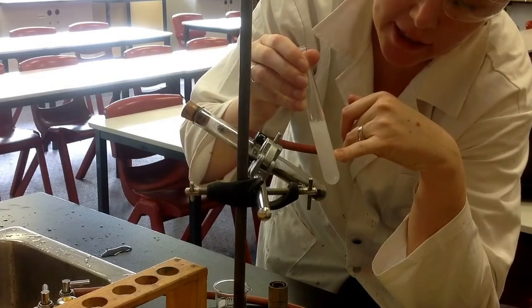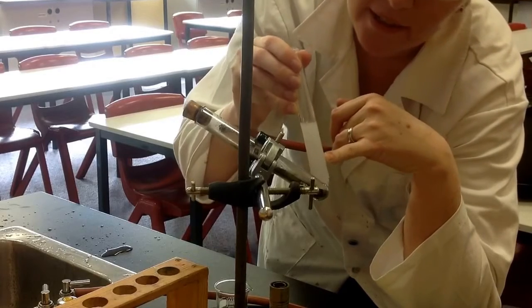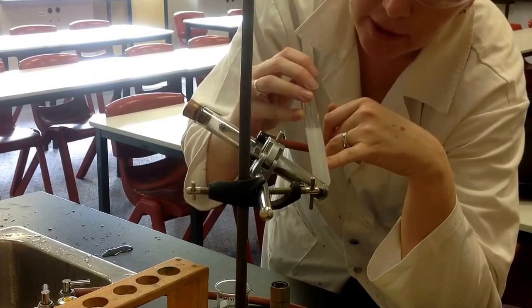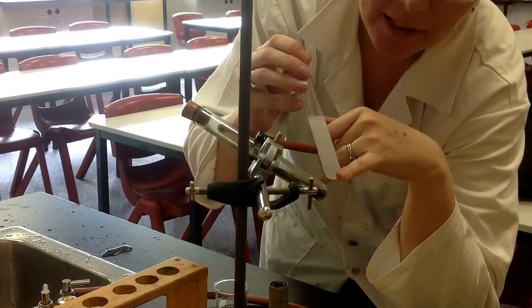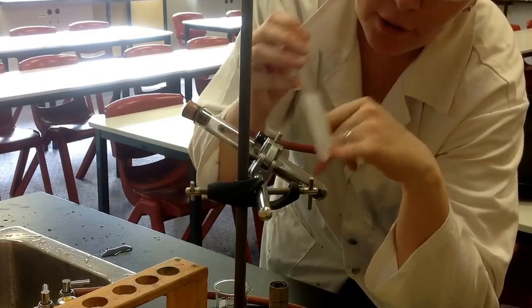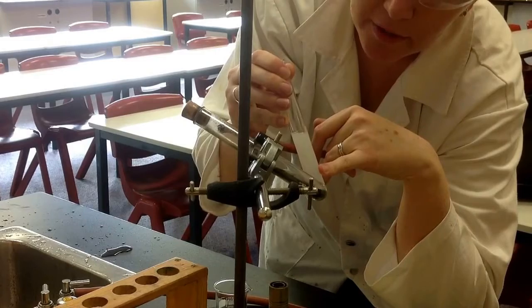And you can see that it's changed this cloudy color. That's actually signifying that there is a solid that has been formed that doesn't dissolve in the water. This solid is calcium carbonate because lime water is calcium hydroxide. So I'll show you the chemical equations for this later on.